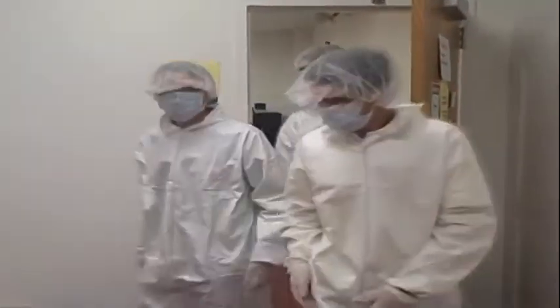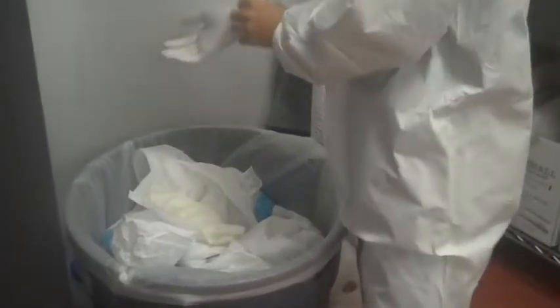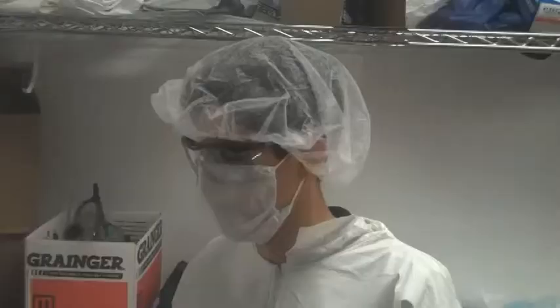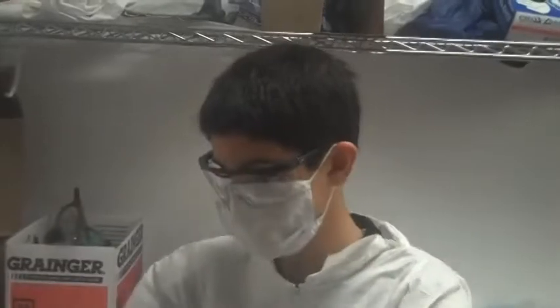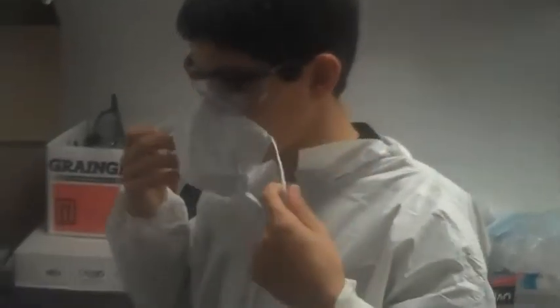It's time to de-gown now. First, we'll start with the gloves. If your hands came into contact with any chemicals in the cleanroom, try to be careful while taking them off — you don't want your skin exposed to them. Next, take off your hairnet and throw it into the garbage can. Then your face mask. After that, take care of your booties and blue shoe covers.